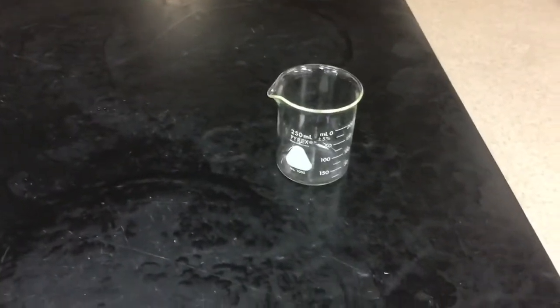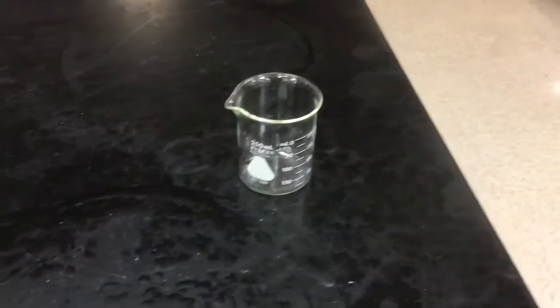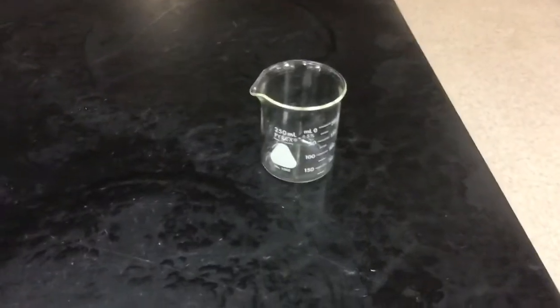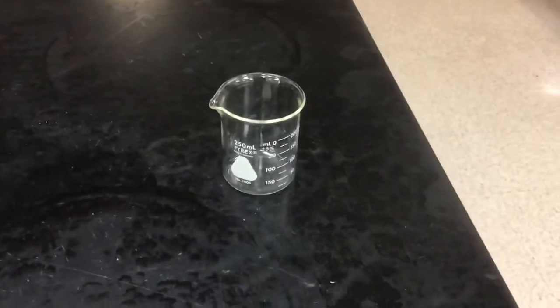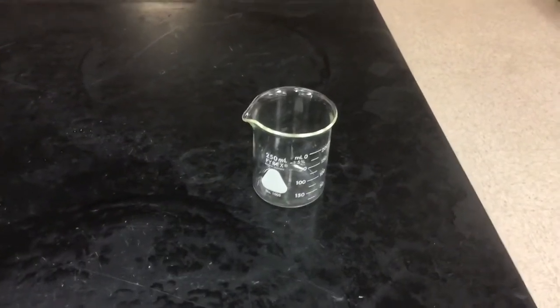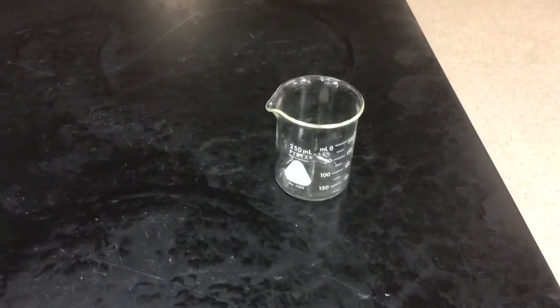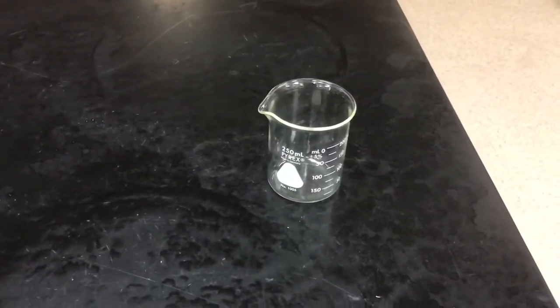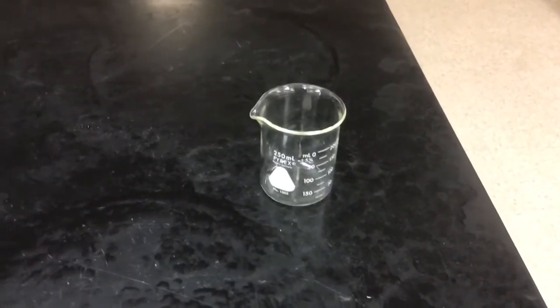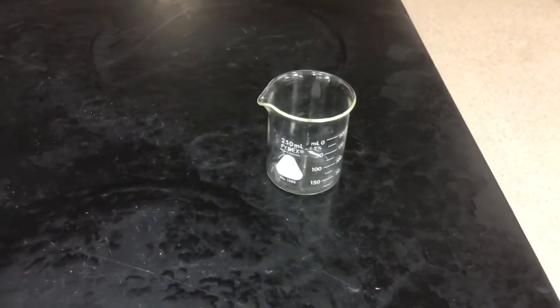Okay, the last 2 tests are for measuring total dissolved solids and biological oxygen demand. Total dissolved solids would be things like road salts and so on. So what we do is we take a 250 milliliter beaker such as the one here, and we mass it, and then we pour a couple of 100 mils of the pond water, the creek water, through a filter paper, and we put that volume of water into that empty beaker that we already weighed, and then we evaporate all the water out.